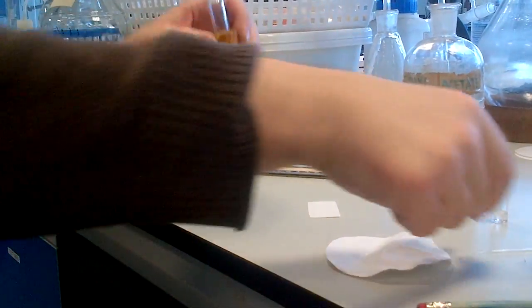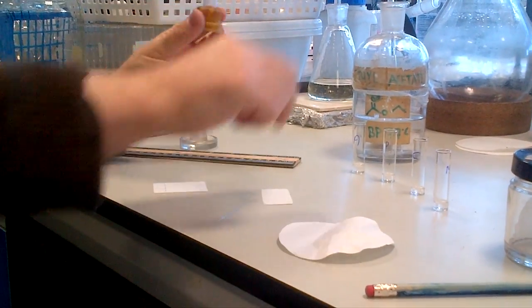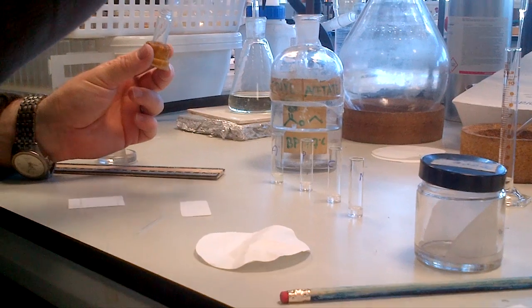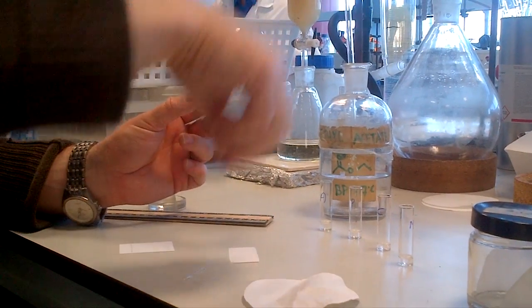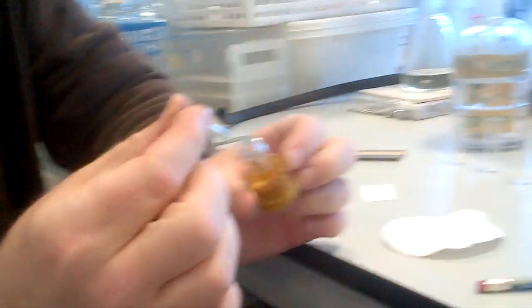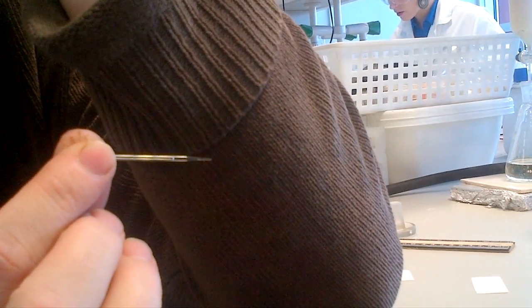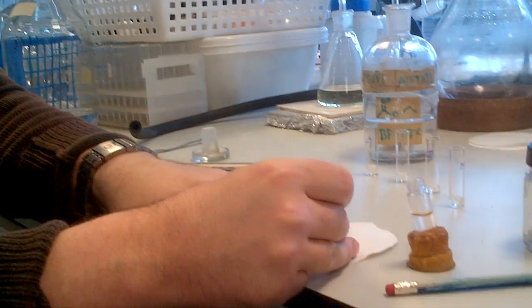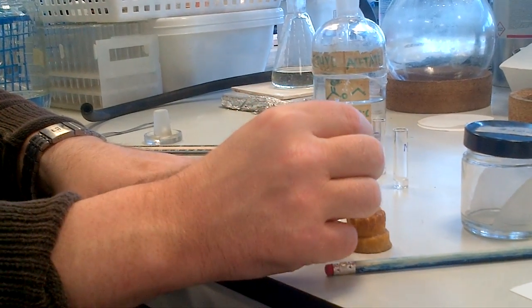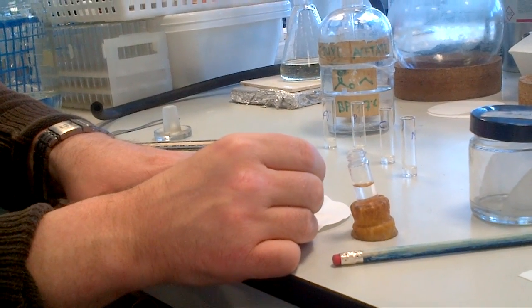You'll need a TLC spotter and a vial of solvent — either the tank solvent or fresh solvent. Take the spotter and clean it by dipping it into the solvent; you should see solvent move up the spotter confirming it's not blocked. Then clean it out thoroughly using filter paper or tissue paper, wiping two or three times to make sure the spotter is completely clean.